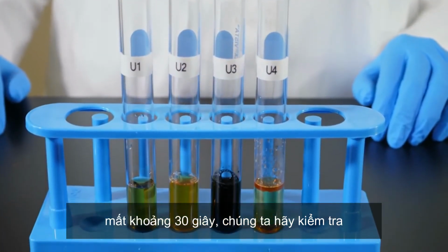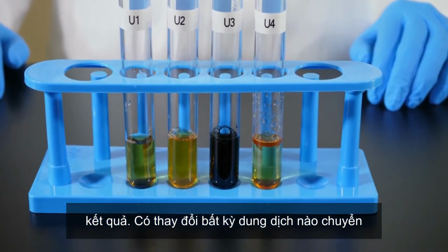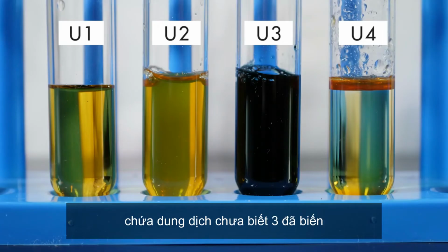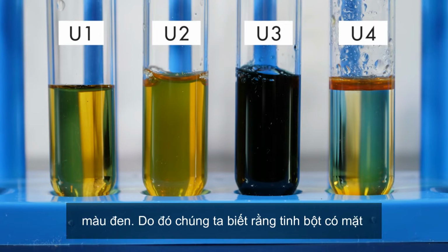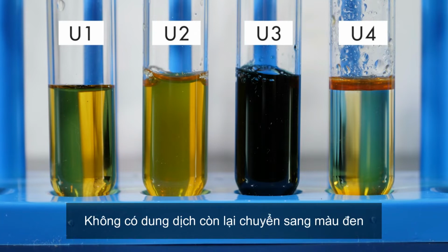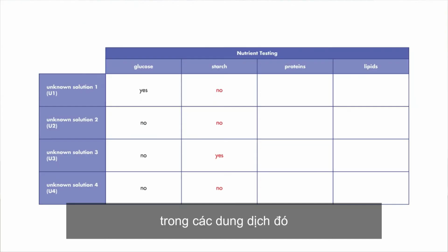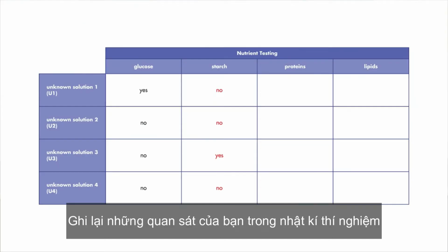Let's examine the results. Did any of the solutions turn black? The solution in the test tube containing unknown solution 3 turned black. Therefore, we know that starch is present. Since none of the other unknown solutions turned black, we know that starch is not present in those solutions. Record your observations in your lab journal.